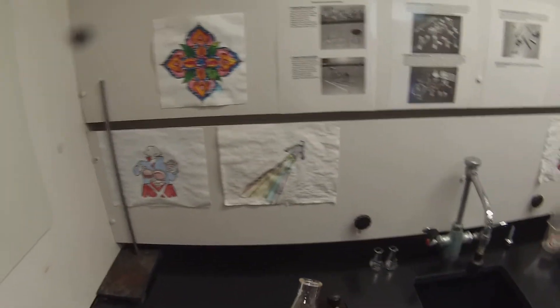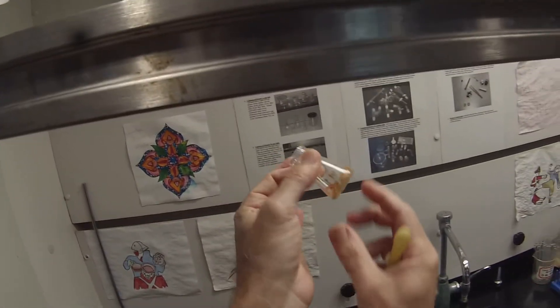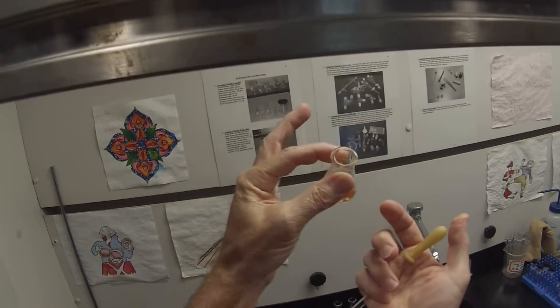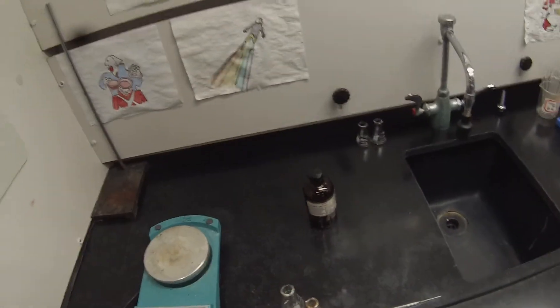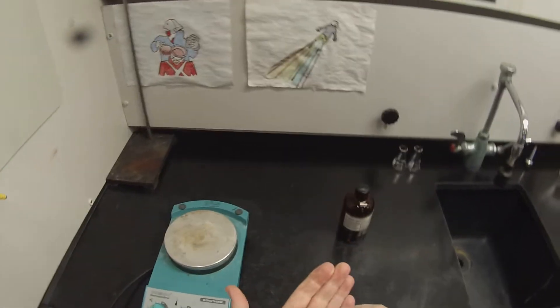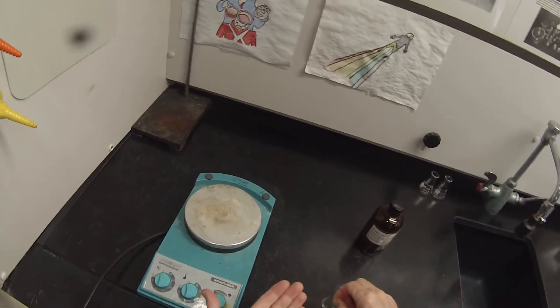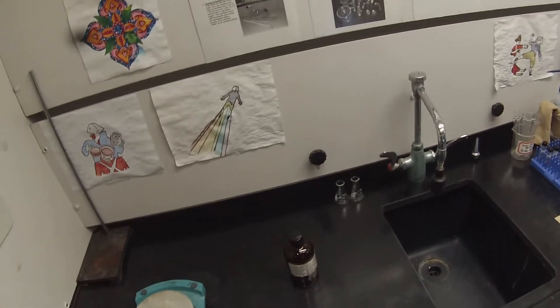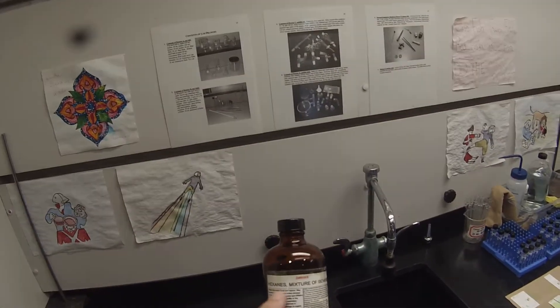We failed with a couple of different solvents to successfully recrystallize the tryptamine and all the solvent has evaporated, so we have our tryptamine back again. I found a paper in the literature that said tryptamine can be recrystallized from pure light petroleum, boiling point 60 to 80, which is effectively the same thing as hexanes which boils at 69 degrees. Light petroleum is probably a mixture of more isomers and therefore cheaper.